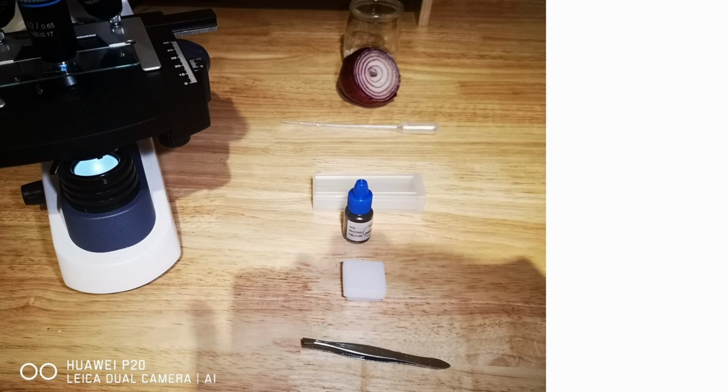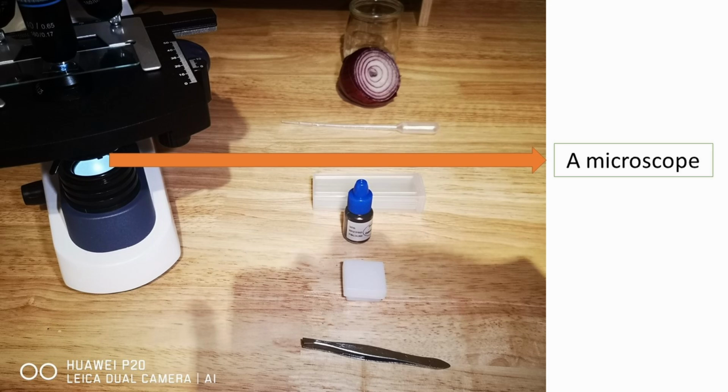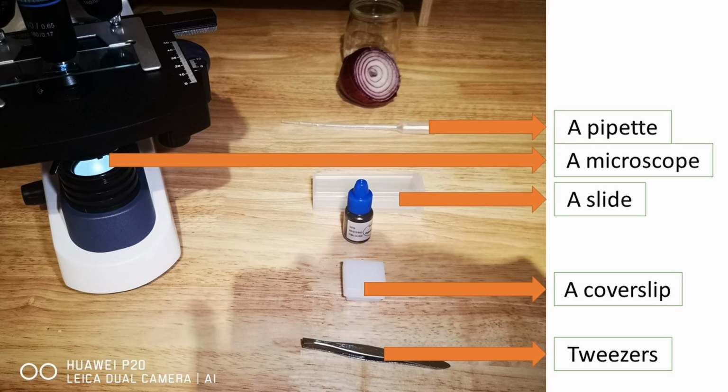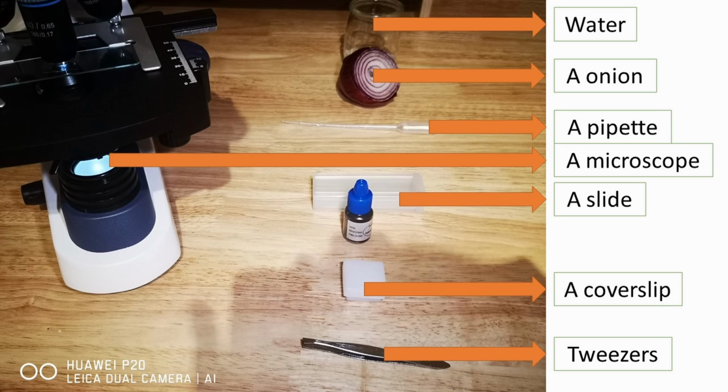Here is all the things that I used. A microscope, tweezers, a slide, a cover slip, a pipette, a red or yellow onion, water, and blue food coloring if you are experimenting with a yellow onion.